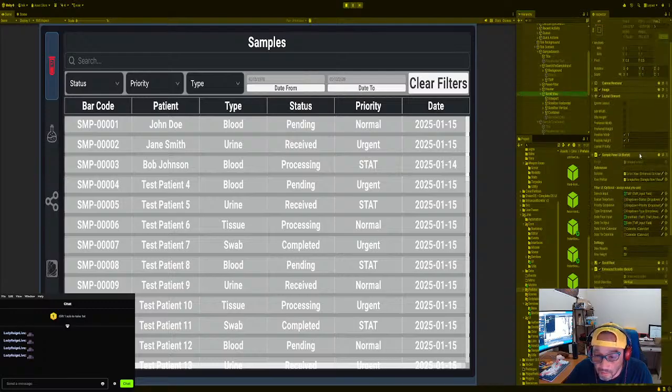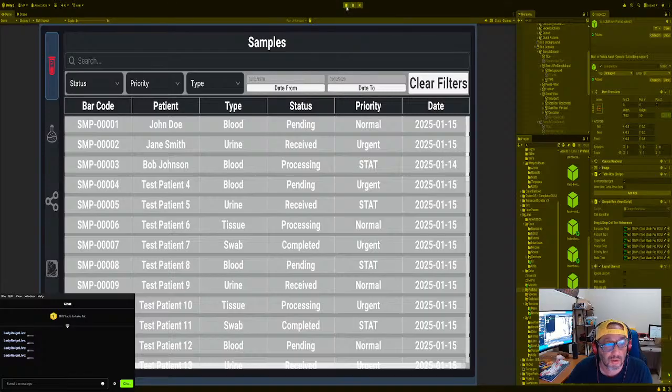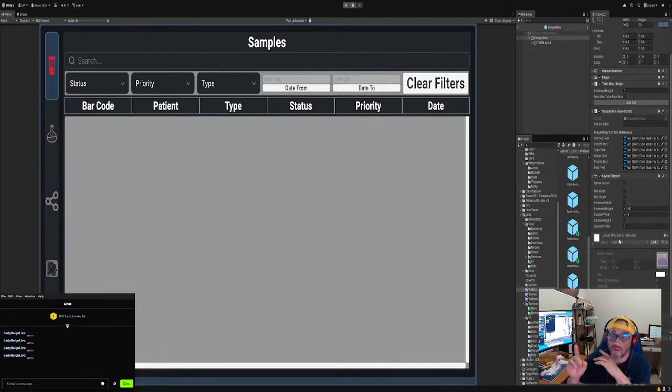Okay, station workflow. So we want to make sure we use the right prefab. What's the prefab? Search input. Oh, sample row prefab right here. So this one, all right. We got this one working really nice, right? But we need to add some functionality to it. We want to make it so when the user clicks, a window pops out with all the information filled out for them already. I think I built it already, but just double check. But anyway, let's do this first, right?